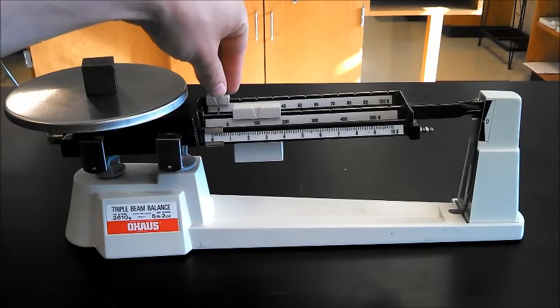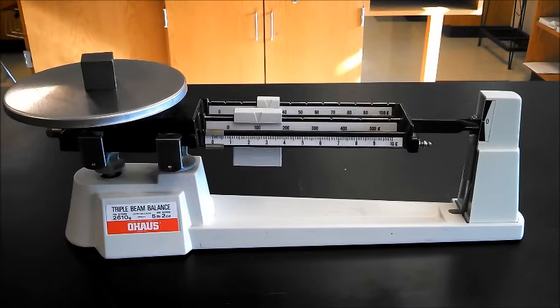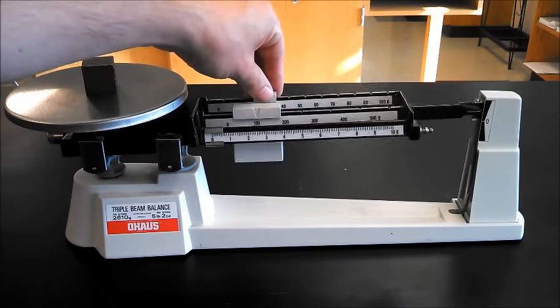We're going to go to the next heaviest, this one in the rear. Move it up, move it up, move it up, there we go. Now we're going to move that one back.